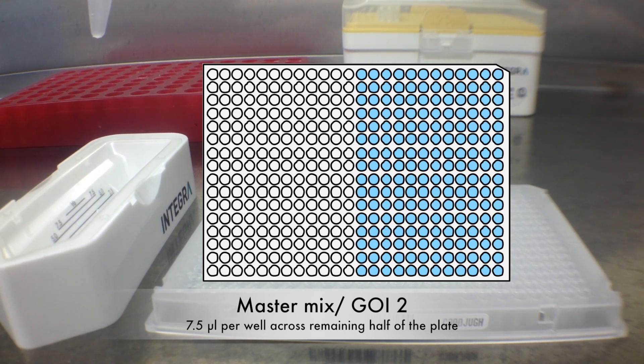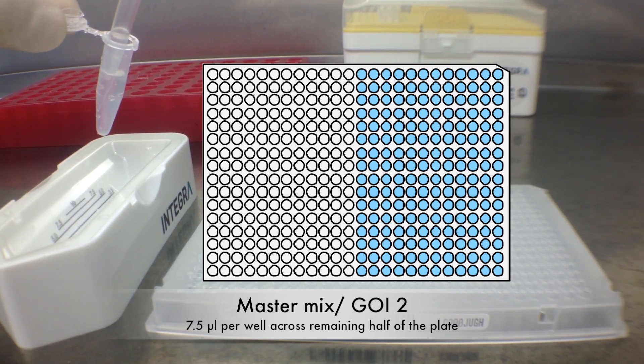Now I'm ready to load my master mix for the Gene of Interest 2 onto the right-hand side of the 384-well plate.